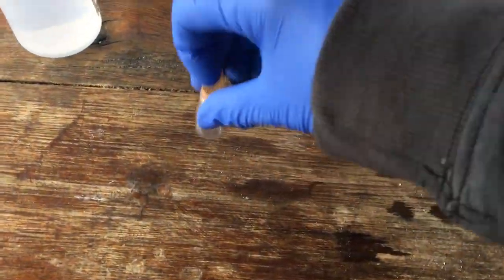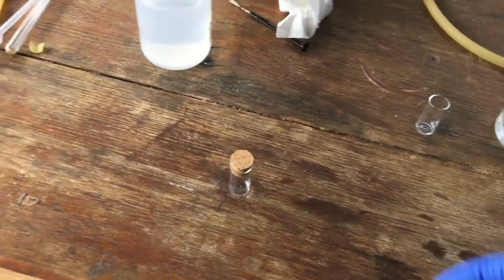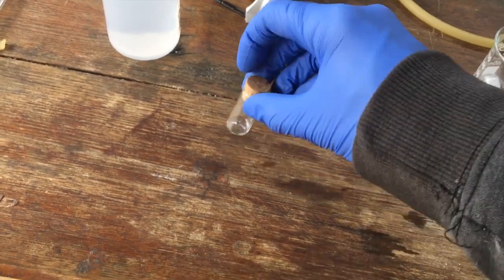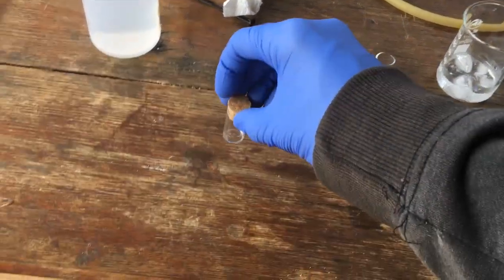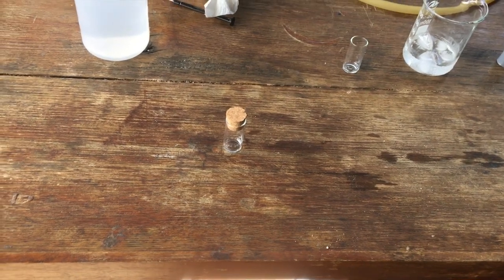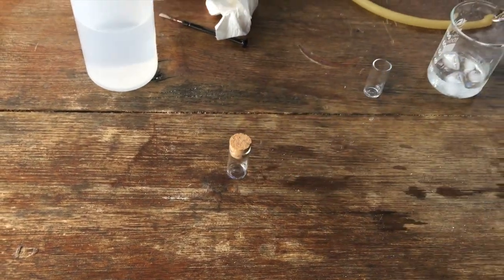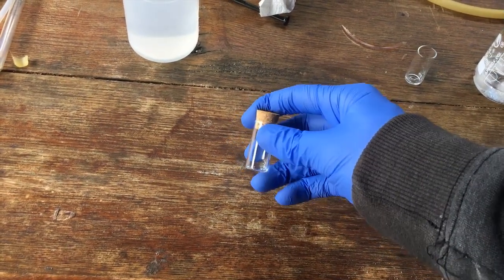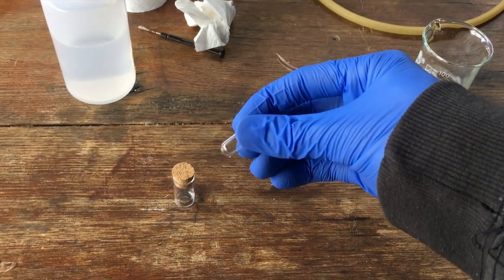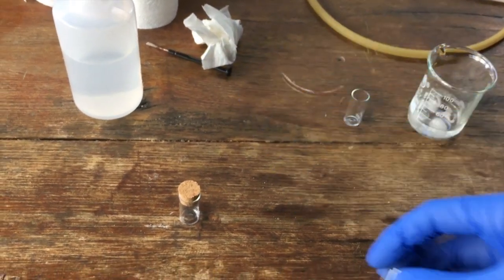So that's quite disappointing. We didn't really get anything meaningful out of this heavy water concentration, which took us a year and a half. But I am, however, still confident that we have enriched the deuterium content of this water to quite a significant degree. It's just not measurable. Maybe it's only like 10% or something like that. If I ever have access to a mass spectrometer, I will be sure to have a go at measuring how much deuterium is in the sample. Anyway, disappointing as this is, I will get the water out of there, put it in an even smaller container. So I'll seal that up and then make it a little bit more visible.